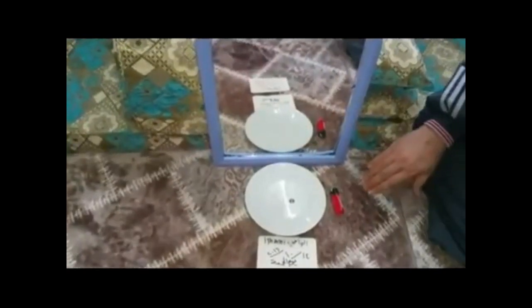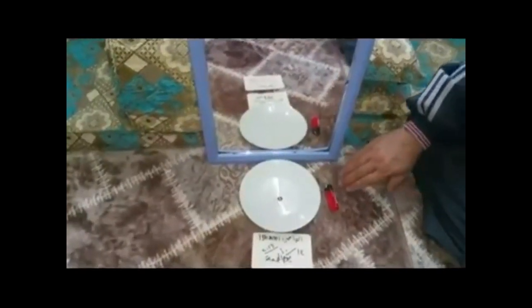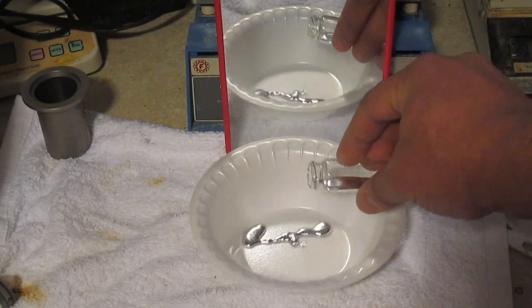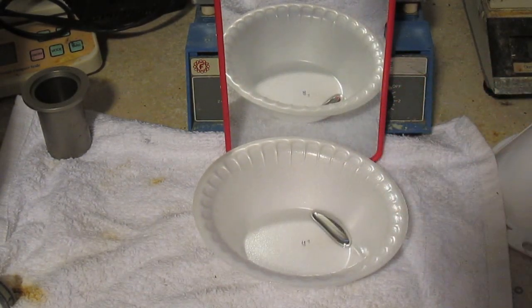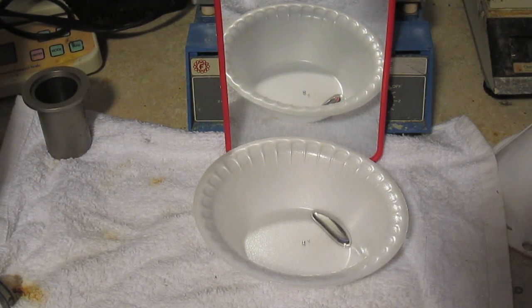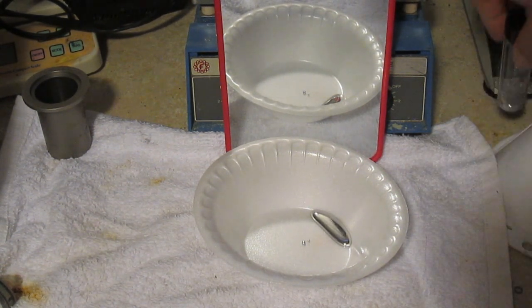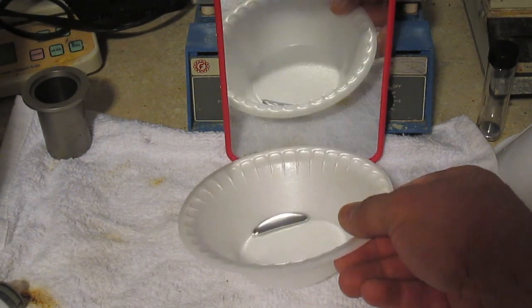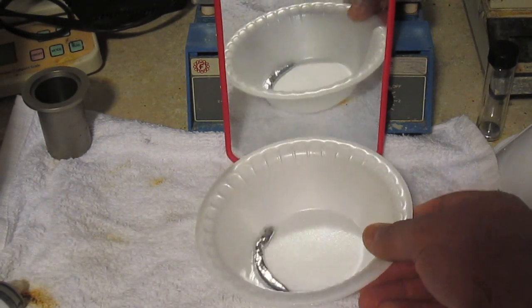As the saying goes, extraordinary claims require extraordinary evidence. I replicated the circumstances and surprisingly I did not obtain the same results. It's a pretty simple experiment and anybody can do it. I'm almost certain I did it right, so I'm confident in my results.